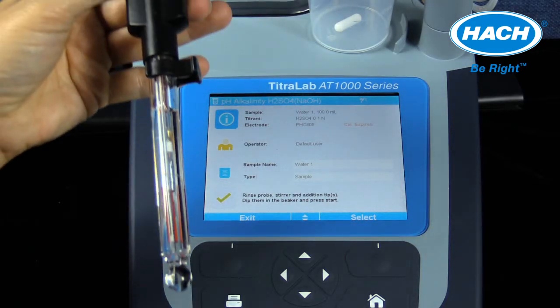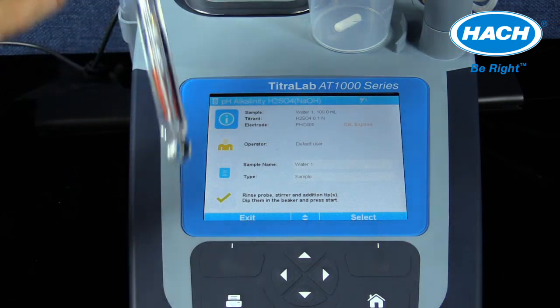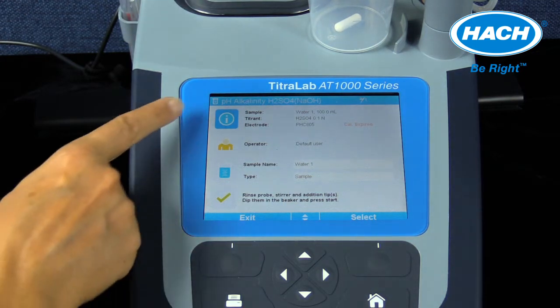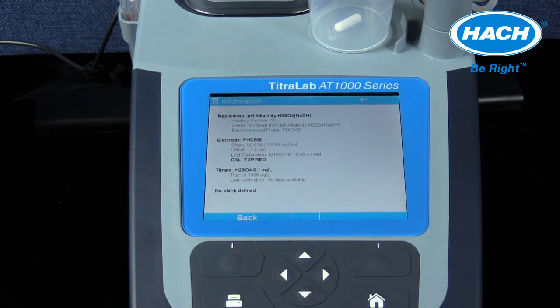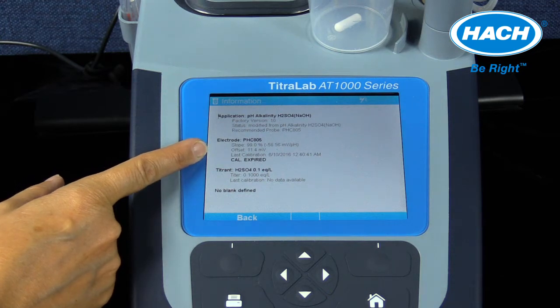The PHC805 pH probe is a general-purpose refillable red rod IntelliCal probe. It is recommended to clean and maintain this probe following the probe manual instructions. To see information about the electrode calibration, the information icon can be highlighted and selected. From the information menu screen, valuable information on the electrode's last calibration date, slope, and offset is displayed. From this screen, the last calibration date of the titrant is also available.